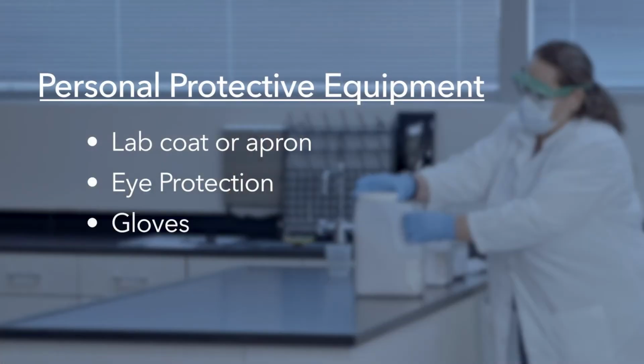procedure. If you are not comfortable cleaning up a blood spill, please alert your lab manager or lab supervisor, or reach out to a member of Valencia's custodial team. Whenever you clean up a blood spill, be sure you put on appropriate PPE, which includes a lab coat or apron, eye protection, and gloves.